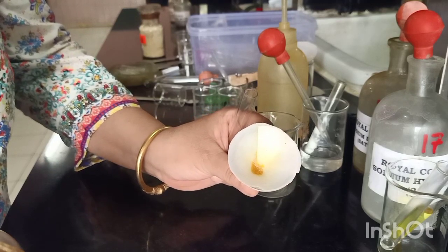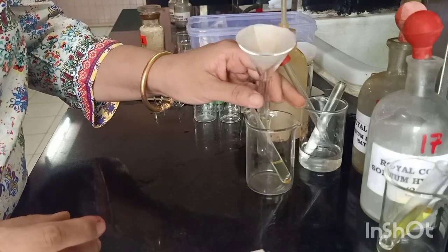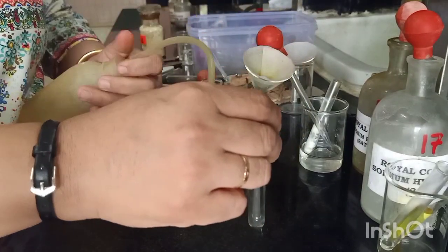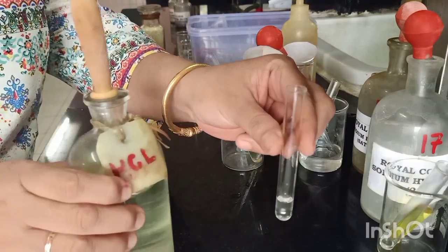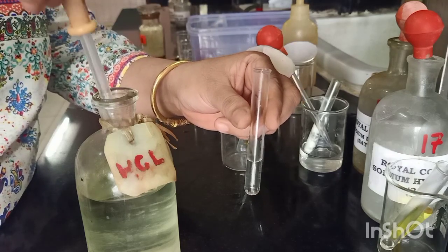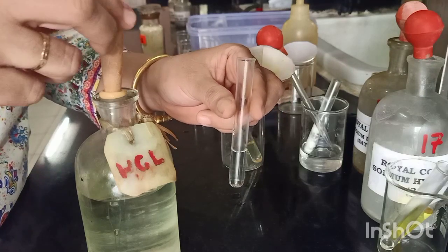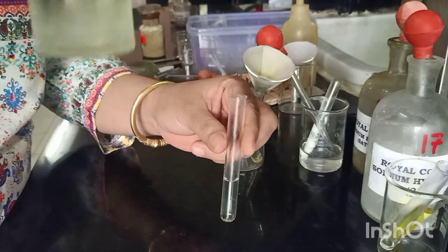Let us now check for the presence of a base. For the base, we need to use 1:1 HCl, which we will prepare. We will take a small quantity of water in a test tube, and to this we will add the acid. This is to be very particularly remembered: whenever you are diluting an acid, you will always take the water and add the acid to it drop-wise, because the reaction is very exothermic. If you do it in reverse, the acid may boil out and you may get burnt. So please be very careful — always take water first and then add the acid. So now that we have prepared our 1:1 HCl, we will proceed to test this component for whether it is a base.